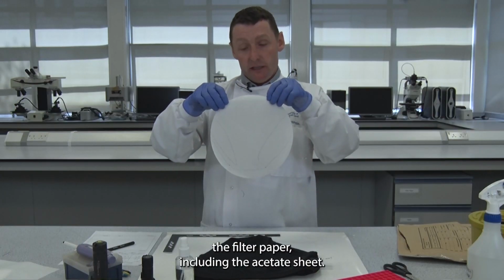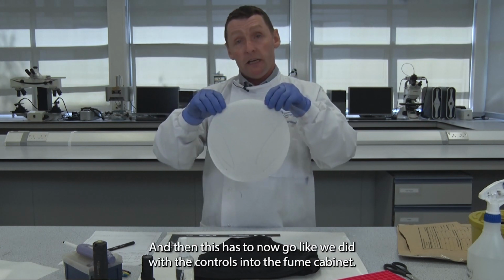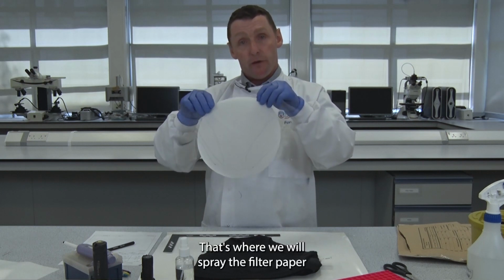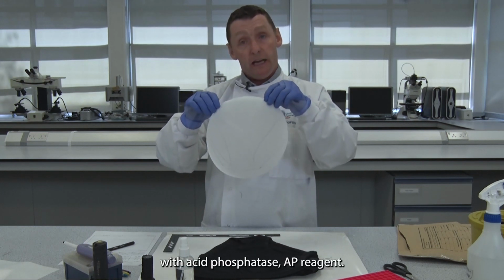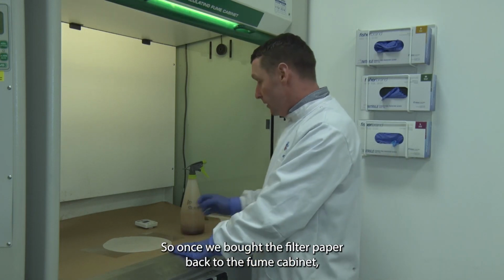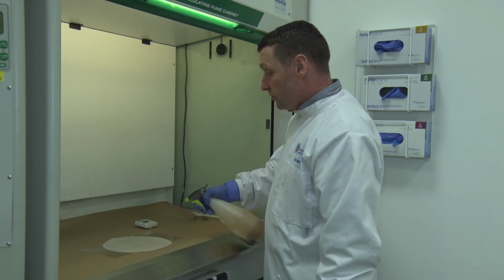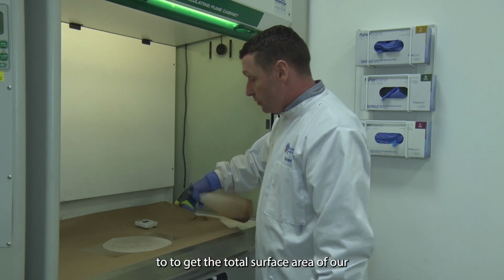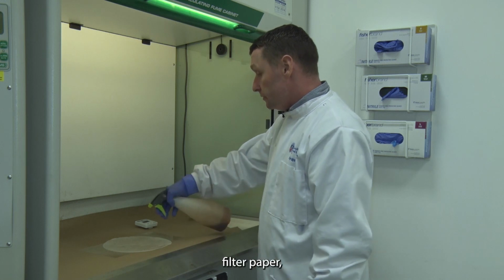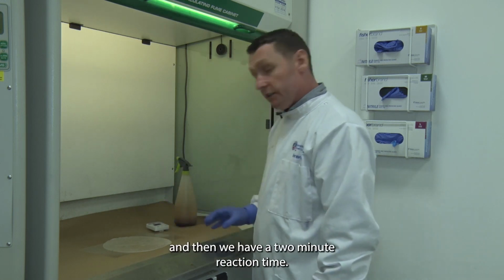including the acetate sheet, and then this has to now go, like we did with the controls, into the fume cabinet. That's where we will spray the filter paper with acid phosphatase AP reagent. So once we've brought the filter paper back to the fume cabinet, we then get our AP reagent, we spray it to get the total surface area of our filter paper, and then we have a 2-minute reaction time.